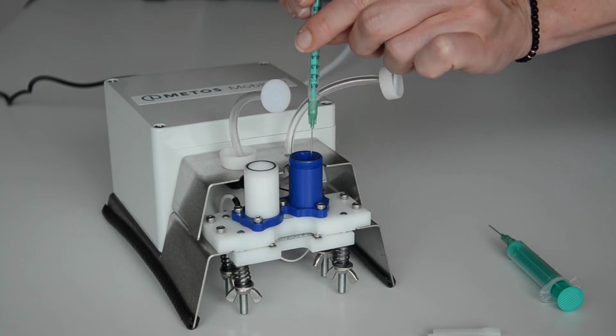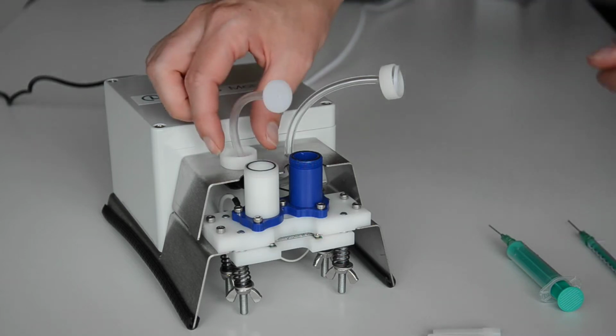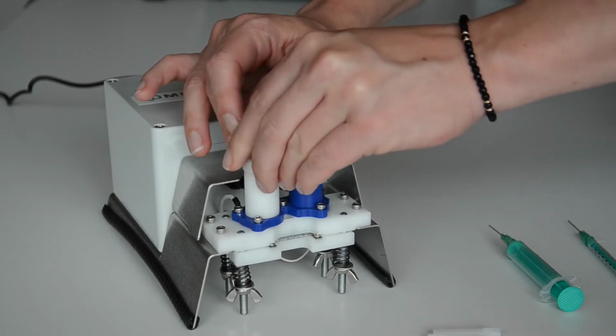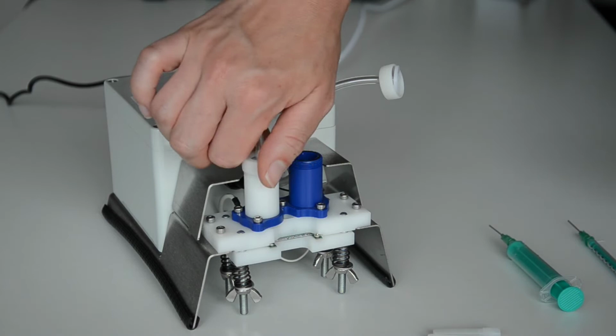Now close the white container again to be ready for the measurements. Since the hose of the blue container has no function, the lid can remain open here. This is only used to avoid contaminating the buffer in a dusty environment.